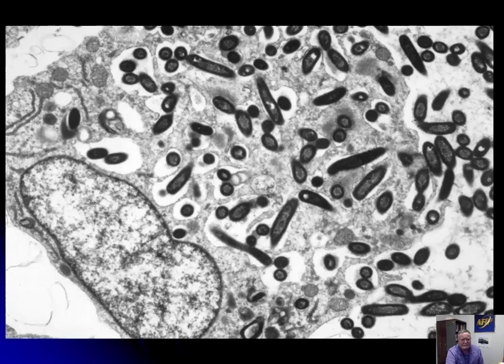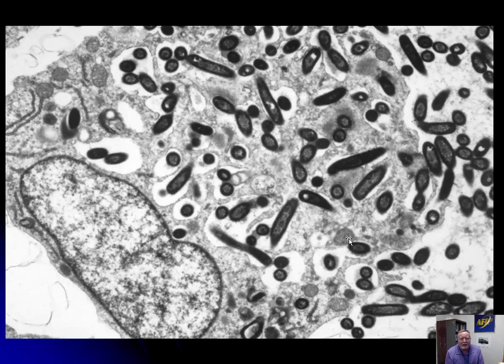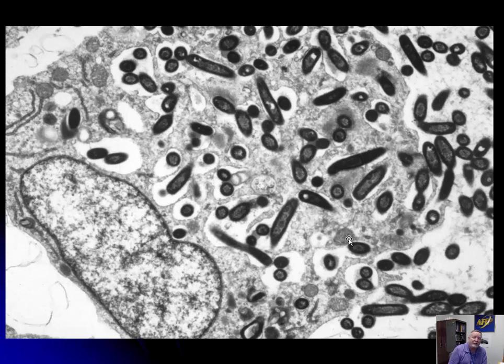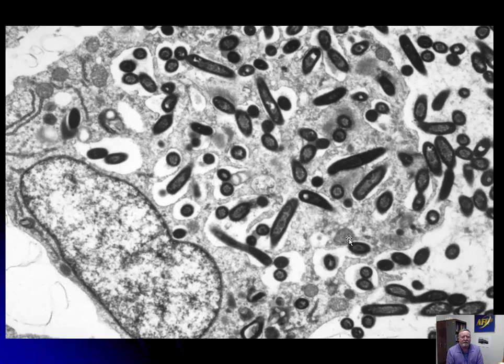This is a macrophage from a fish — a fathead minnow — rife with granulomas, and this macrophage is full of bacteria. You might think you know what that is, then realize you have no idea because all bacteria look alike. You have to know that this fish had granulomas throughout its body, and the granulomas turn bright red with a Ziehl-Neelsen stain — this is a Mycobacterium, one of the avium intracellular forms. This picture was taken so long ago they just called it all Mycobacterium avium. Bacteria — you just can't do too much with them.